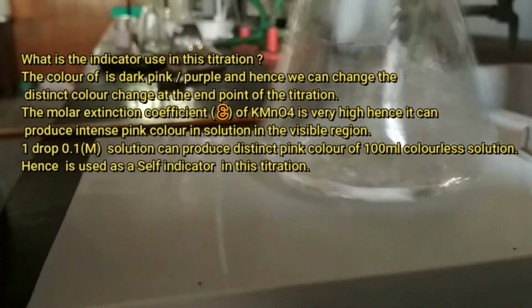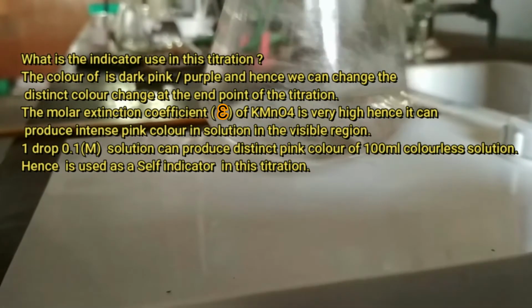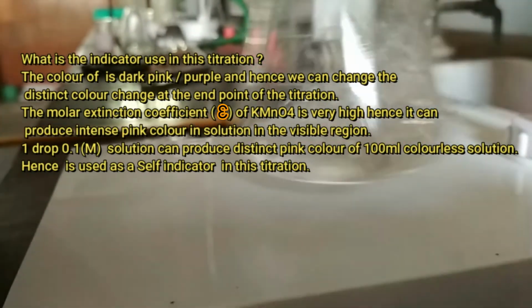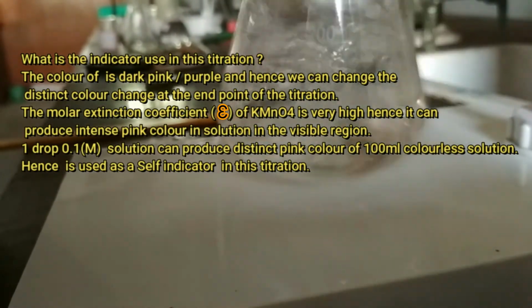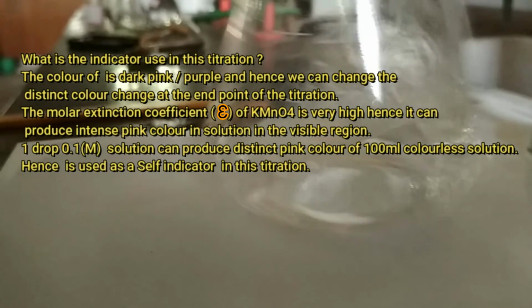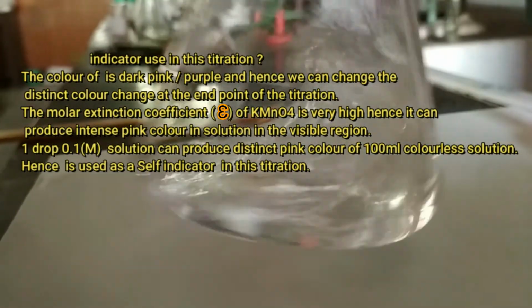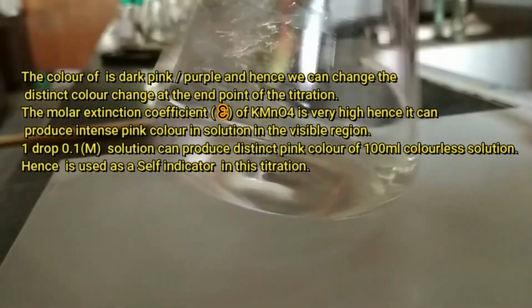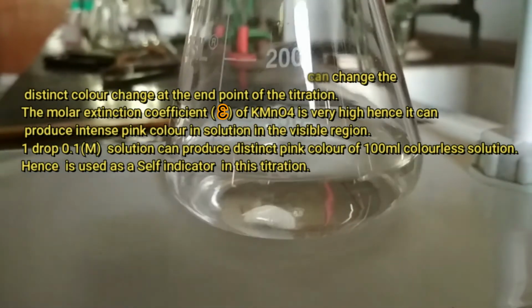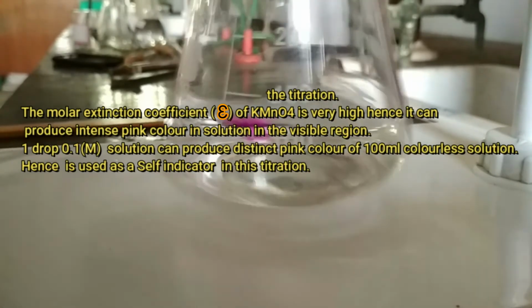It is due to the very high molar extinction coefficient of KMnO4, which is denoted by epsilon, and hence it can produce an intense pink color of the solution in our visual region. One drop of 0.1 molar solution of KMnO4 can produce a distinct pink color in 100 ml of colorless solution. Hence, here potassium permanganate is used as a self-indicator.